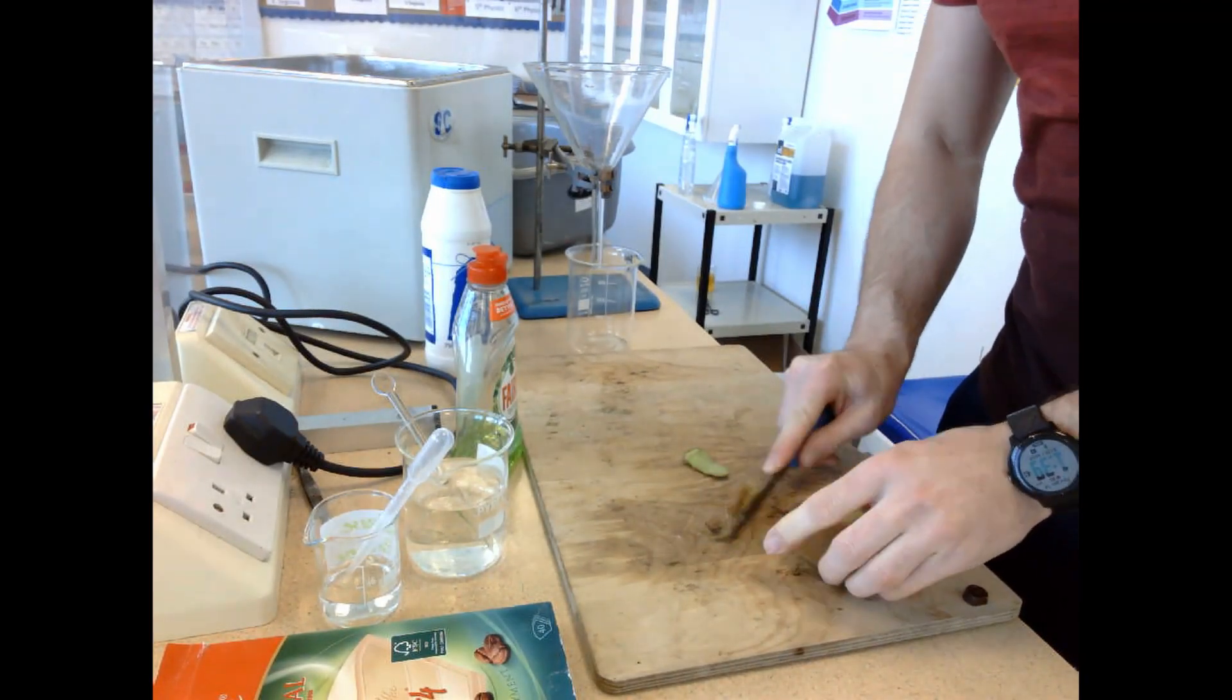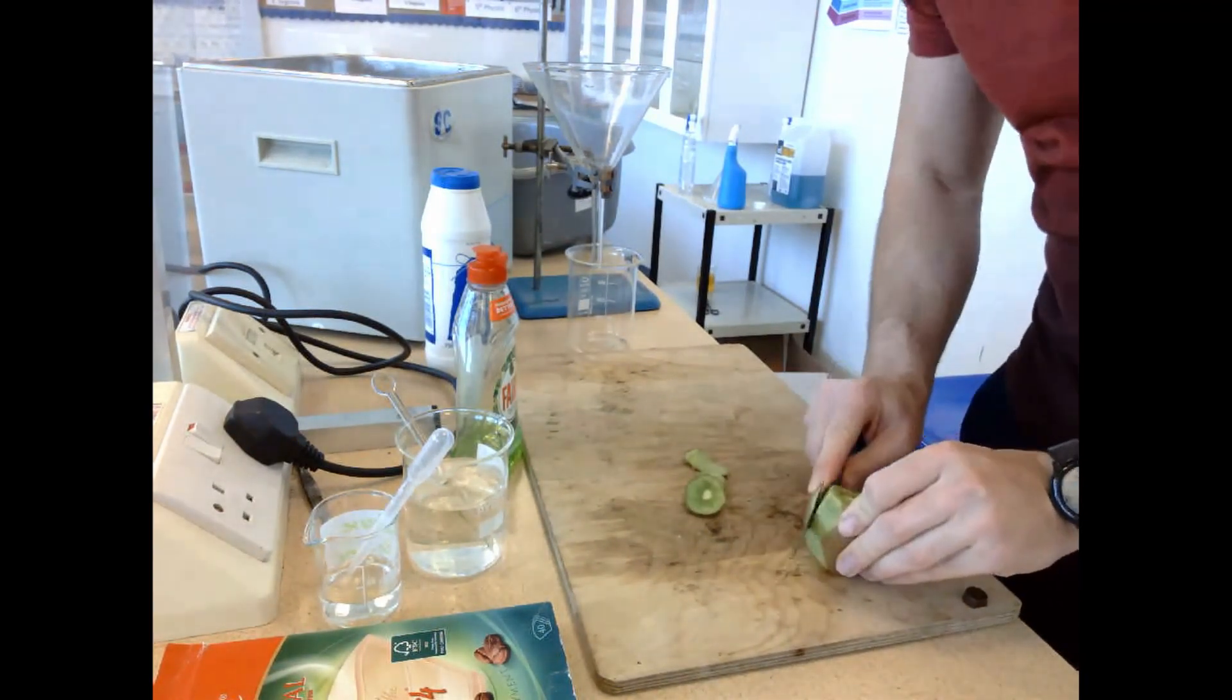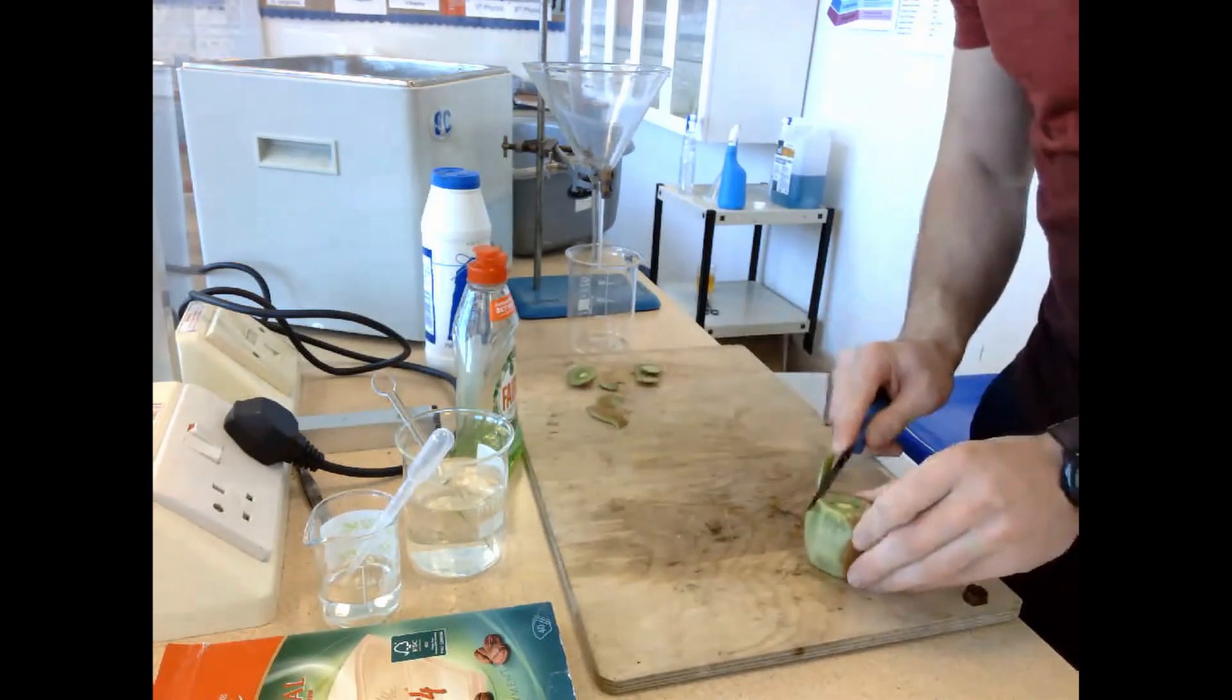We are looking to isolate DNA from plant tissue, and the plant tissue we're using on this occasion is that of a kiwi plant.